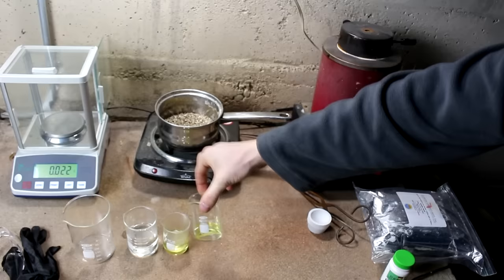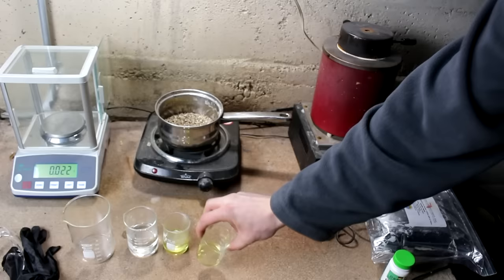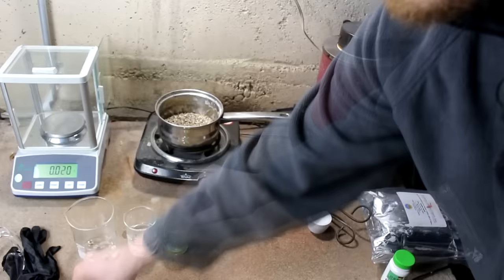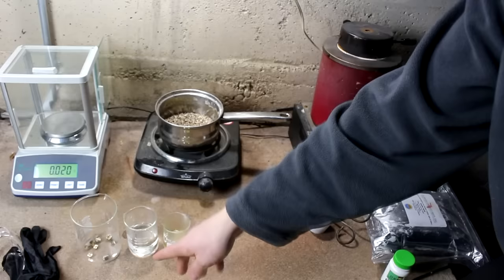Let's get started. I took a small piece of the gold and put it inside this flask with some aqua regia mixed up. Aqua regia is the mixture of these two acids. The idea here is to see if inquartation is necessary — if there's too much silver, the aqua regia would not dissolve it. It looks like it dissolved without trouble, so we're going to go ahead and put the pieces in without the inquartation process. If the silver concentration is too high, it'll form a protective layer keeping the metals from dissolving, but if silver is low enough, it'll just flake off as silver chloride and the metals will completely dissolve.